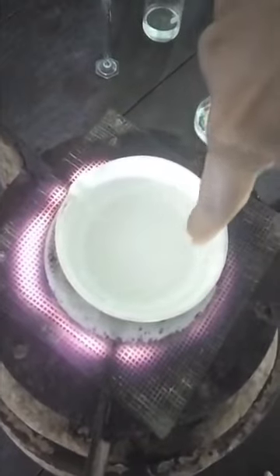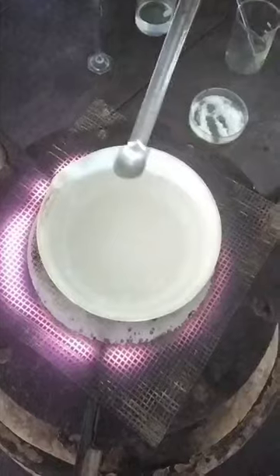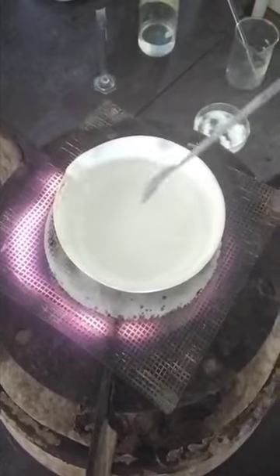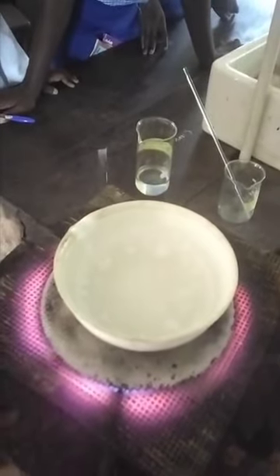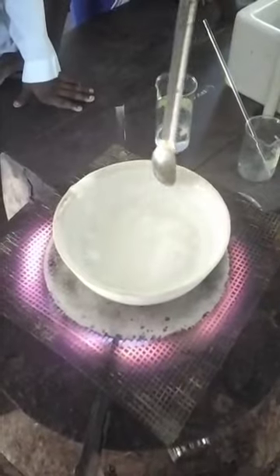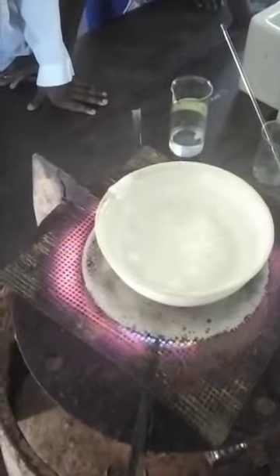So you can see now, as we keep applying heat, can you see that the salt is gradually separating? Okay, can you see the salt here, the salt crystals? Can you see the water here? As we keep applying heat, the water will keep evaporating, okay? Actually, this method is majorly used in the salt industry. Here, most of the time they will just get seawater, and when the seawater is gotten, the water is allowed to evaporate, leaving the salt in the evaporating dish. So you can see now as it's boiling. Are you seeing it boiling? Yes. Okay, so the water will keep evaporating, and then our salt will be left in the evaporating dish.